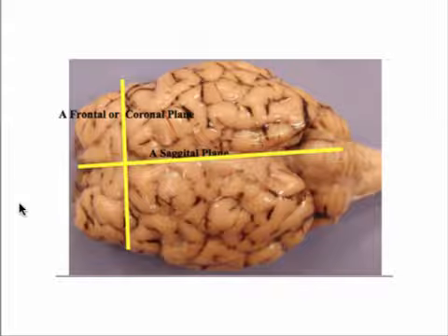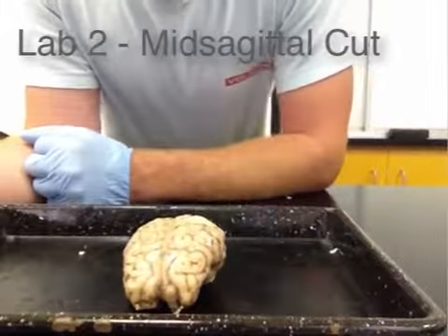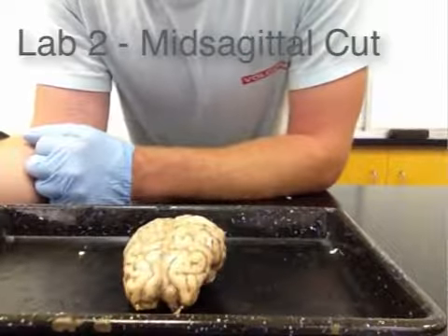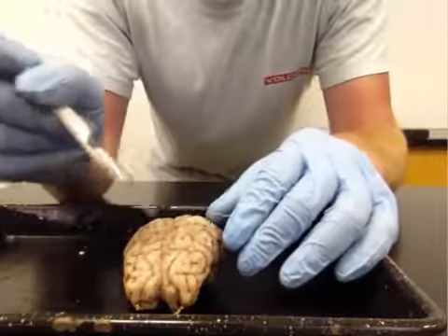So let's take a look at how we're going to make this cut and some of the structures that will become visible to us. For lab 2, we're going to be making a sagittal cut on the brain. And this will allow us to separate the 2 hemispheres.